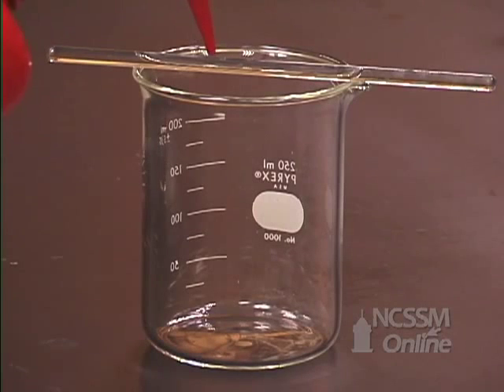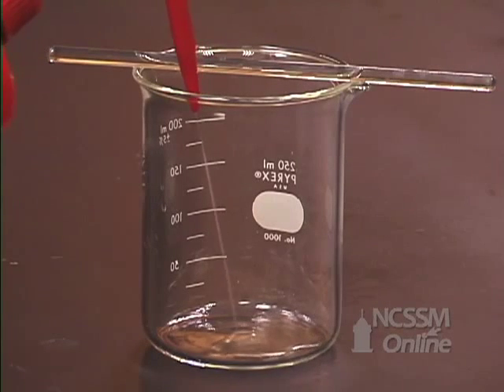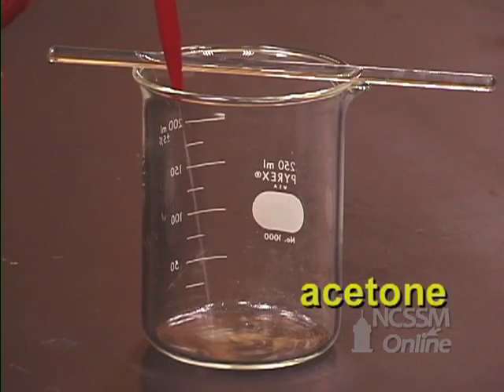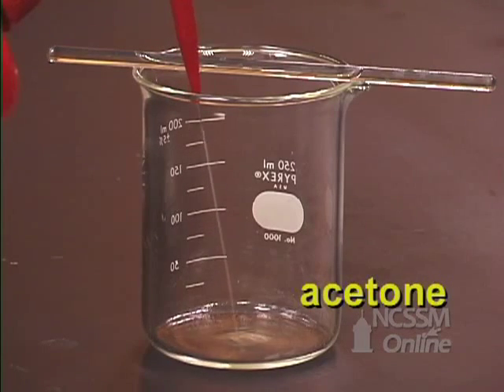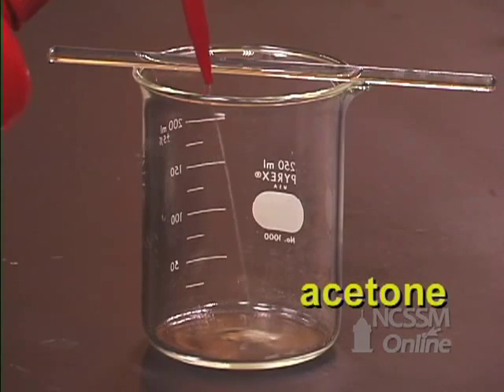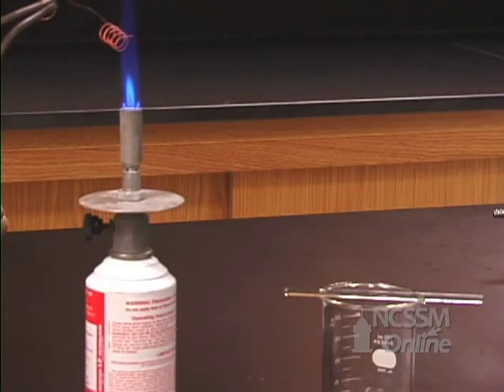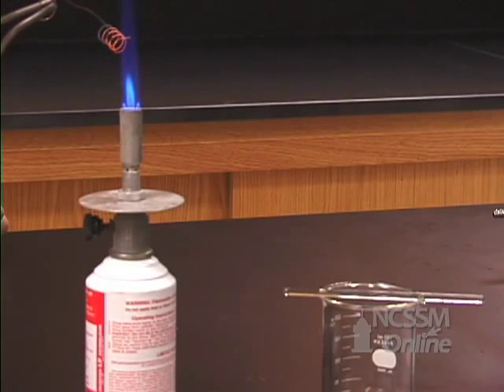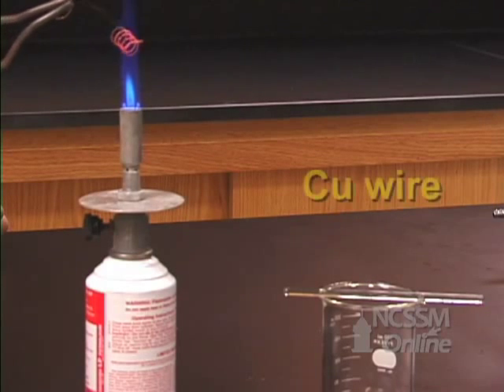We will demonstrate a solid-state catalyst. We'll place a small amount of acetone in the bottom of a beaker. We'll heat a copper wire and suspend it from a stirring rod above the acetone.